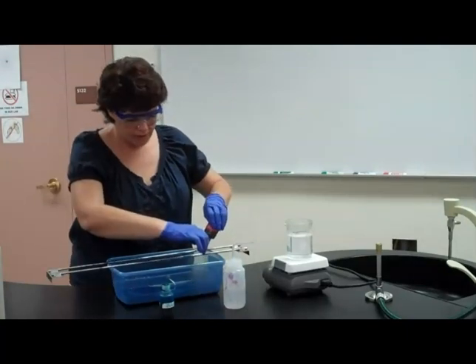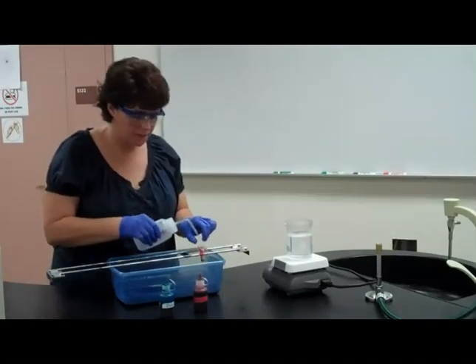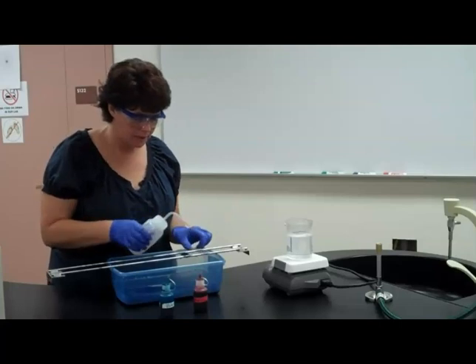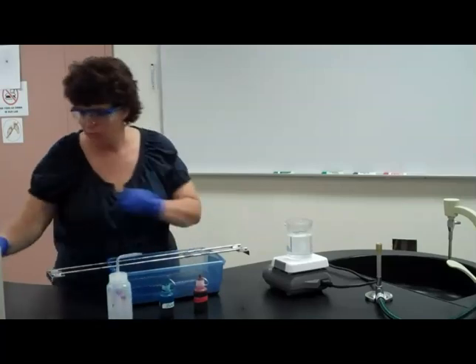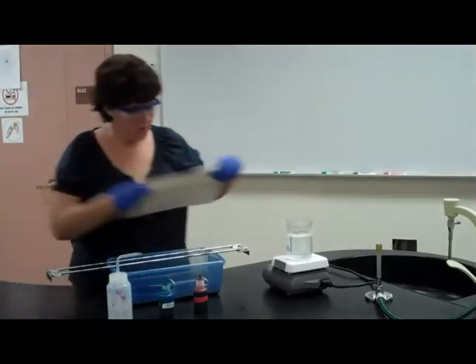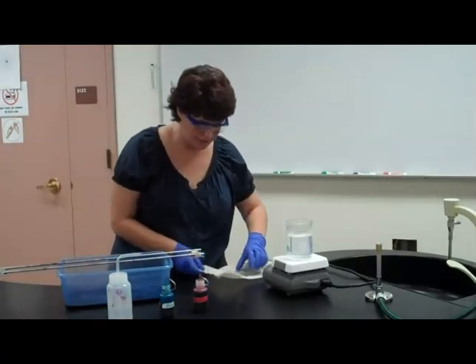So after that's set its time, I'm going to rinse. So again, rinse, rinse, rinse. Don't be afraid. You can't really over rinse. Now you don't want to spray directly on the culture. And as we did before, we're going to blot dry. Okay? After we stain, we blot dry.